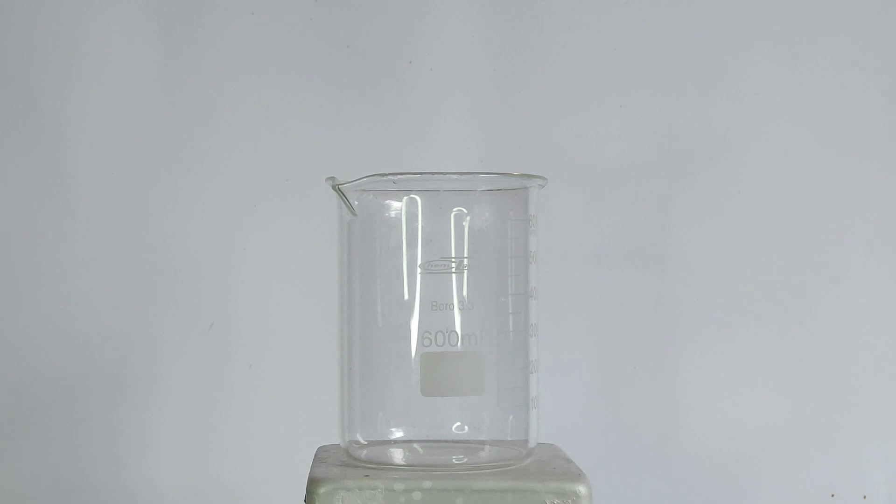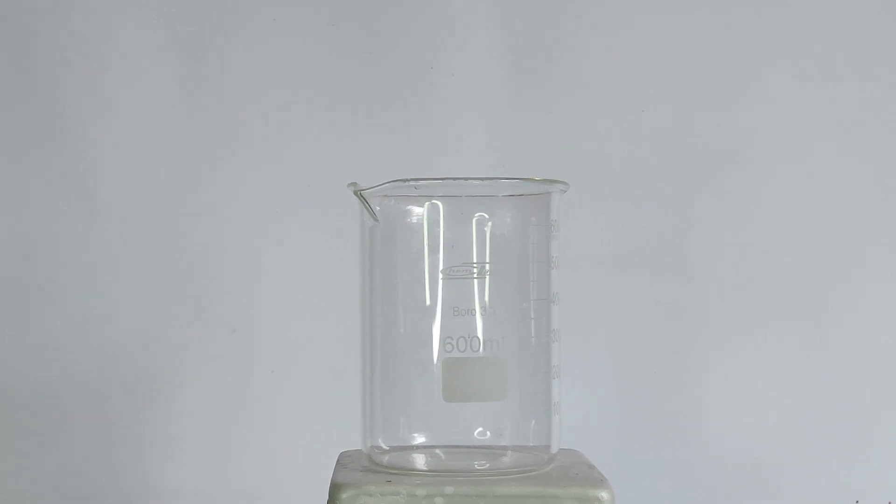Okay, so to begin, I've had to turn some iron into iron-2-chloride. To do this, to a 600ml beaker, I've added a bunch of steel nails.